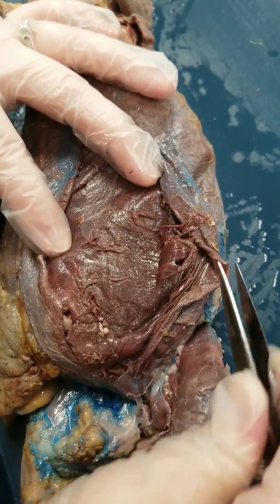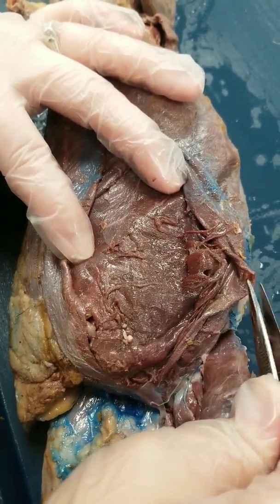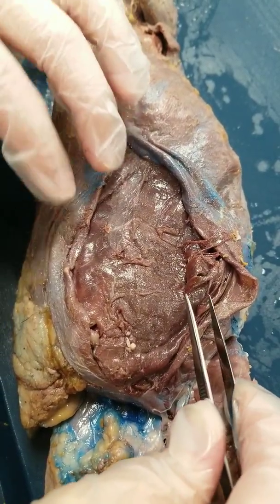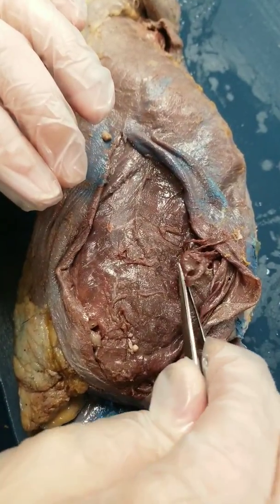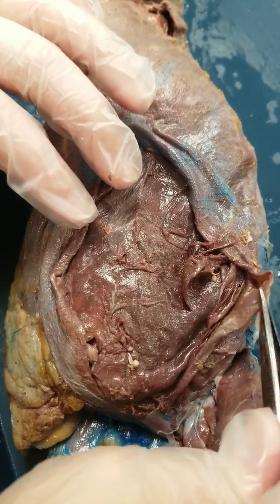It's going to shred a little bit. I do not expect you to pull this back as far as you do the external oblique, because the more you pull it, the more likely it is to fall apart. I recommend you pull it back far enough that you can distinguish it from the top layer, but it should not pull back as far.